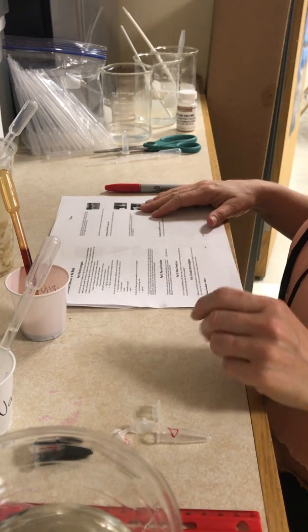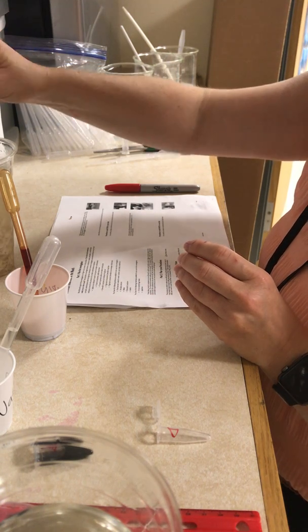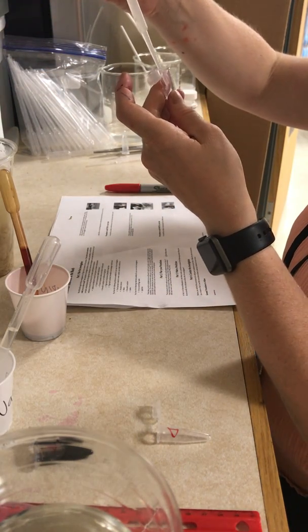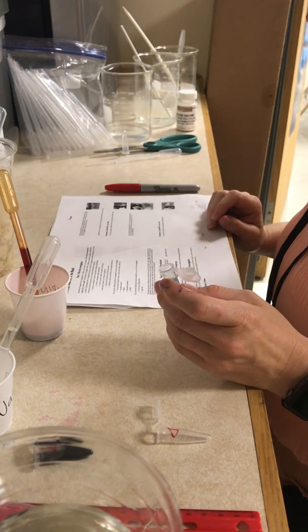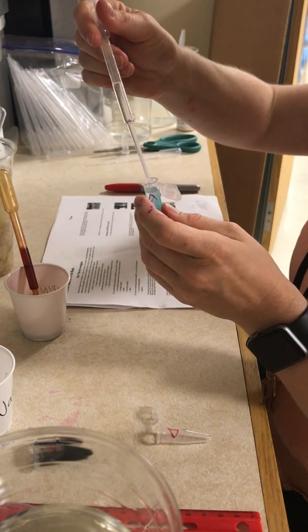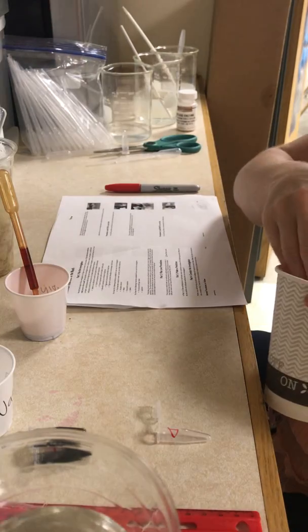For tube C, I'm going to add 0.5 milliliters of our food, which is crackers. This time, I'm going to add 0.5 milliliters of Benedict's — one, two, three, four, five drops, up to 1.0. And I'm also going to add five drops of water. So tube C has crackers, water, and Benedict's. I'm going to mix it and put this one off to the side in a coffee cup.